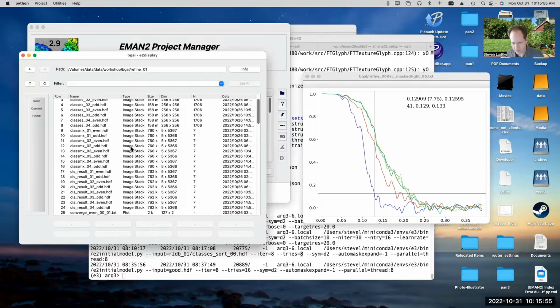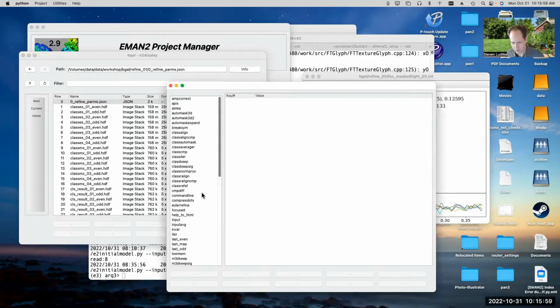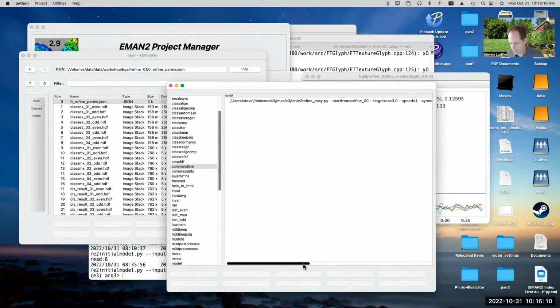So if we look at the second refinement that I ran, the one that was targeting higher resolution, we can look at the refinement parameters in this one really quickly. Sorry, command line. And I told it to start from refine 00. So that's going to use the final structure that came out of refine 00 and the same data set. So it's for doing continuations where you want to change some of the parameters.